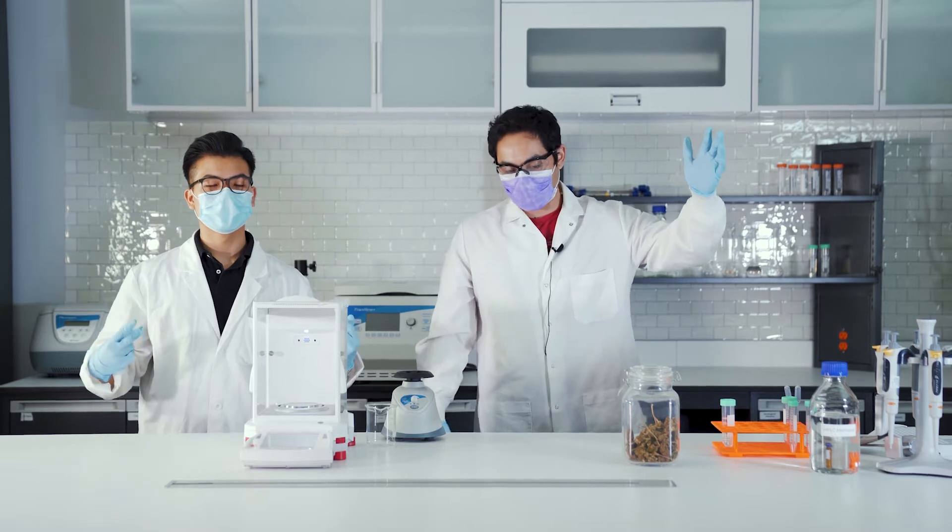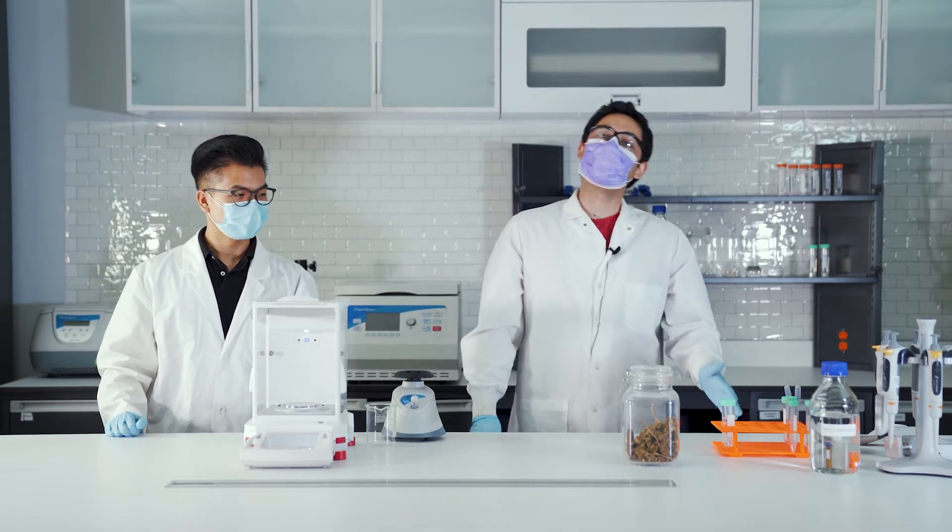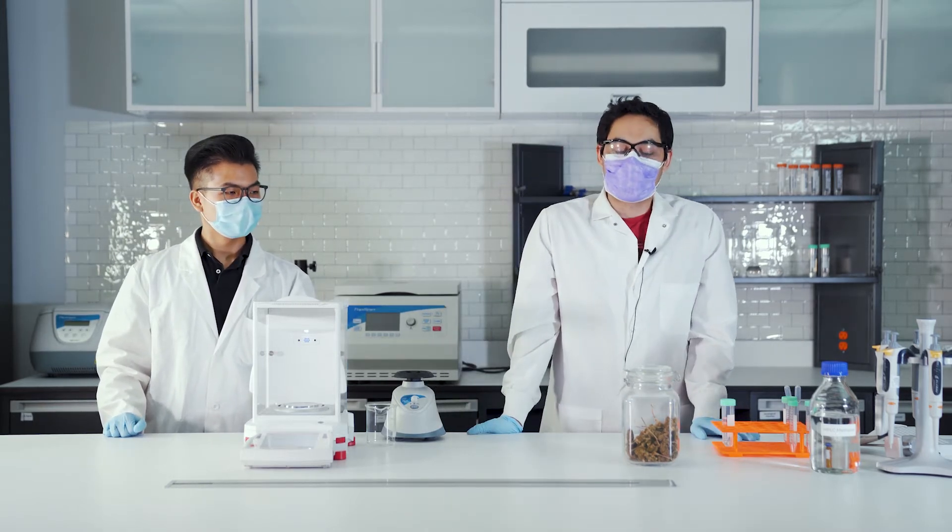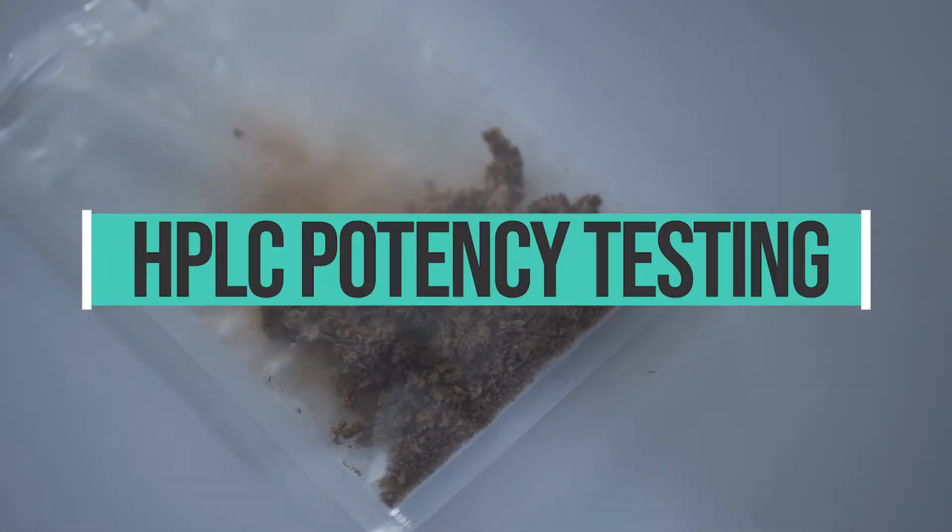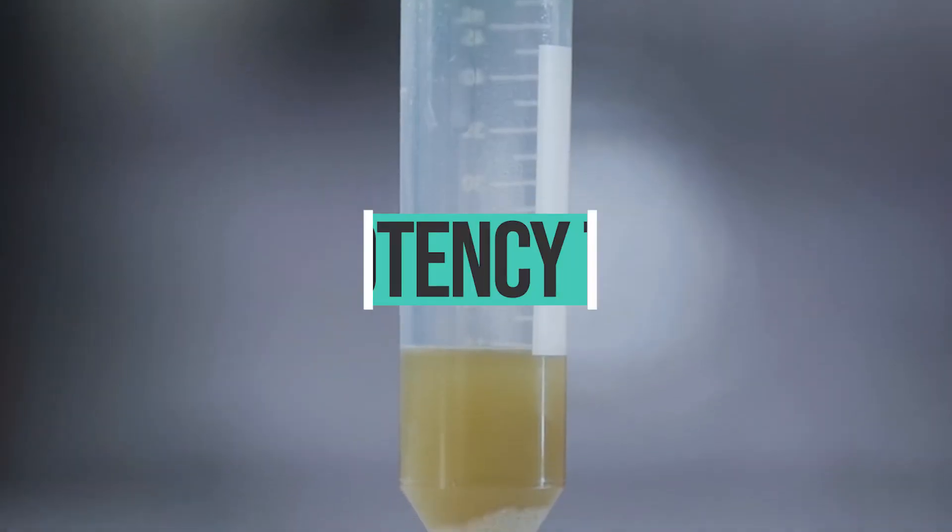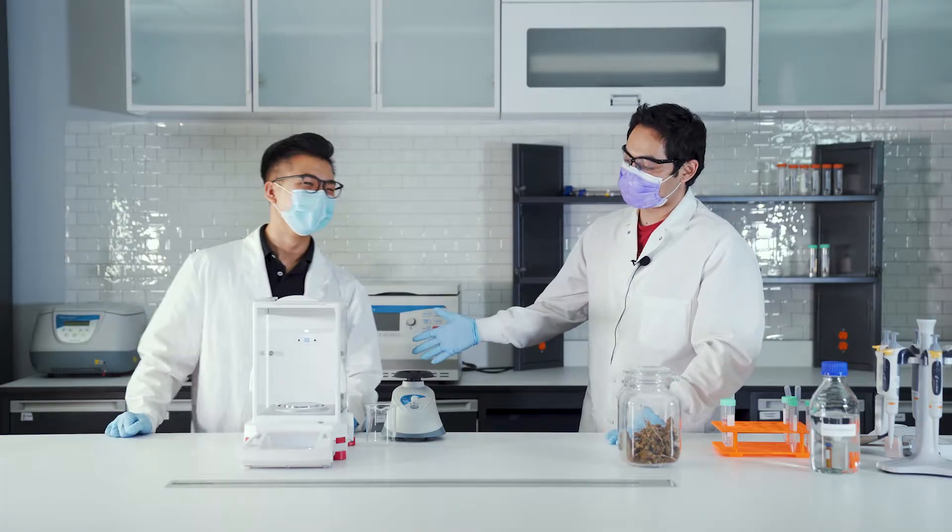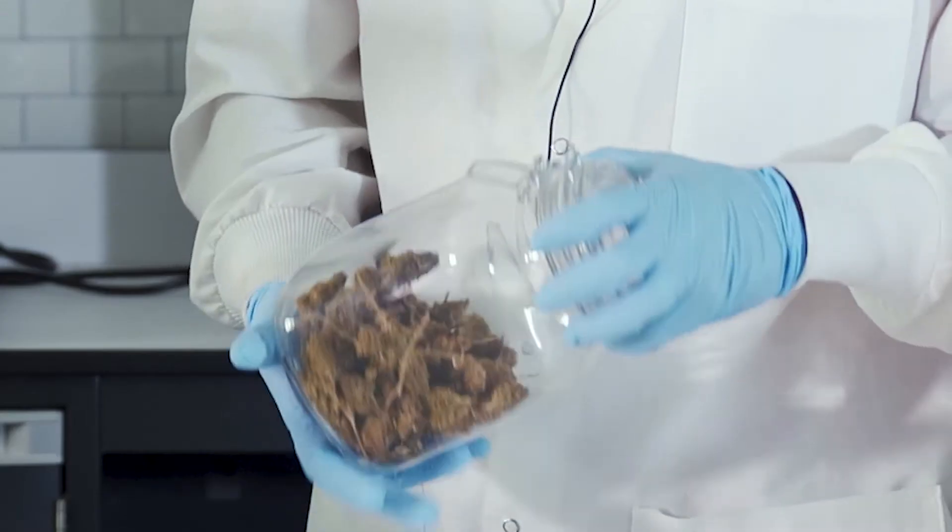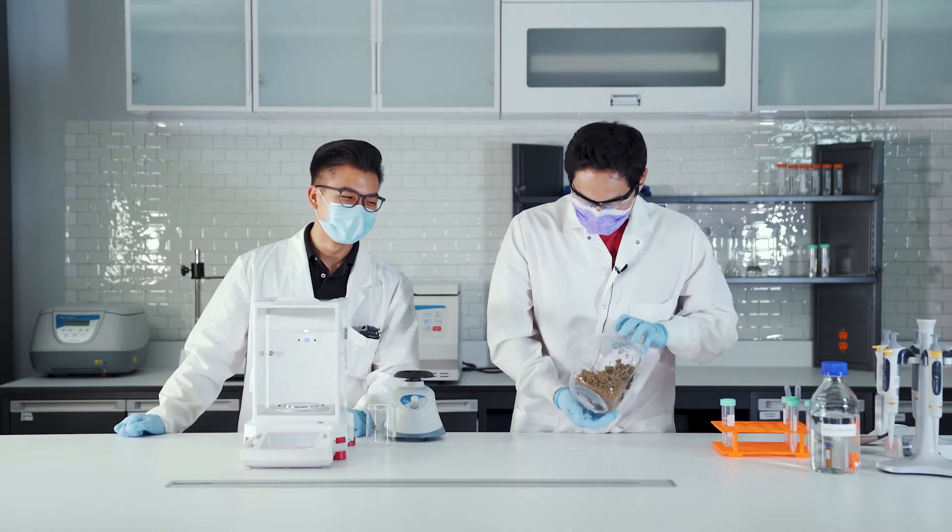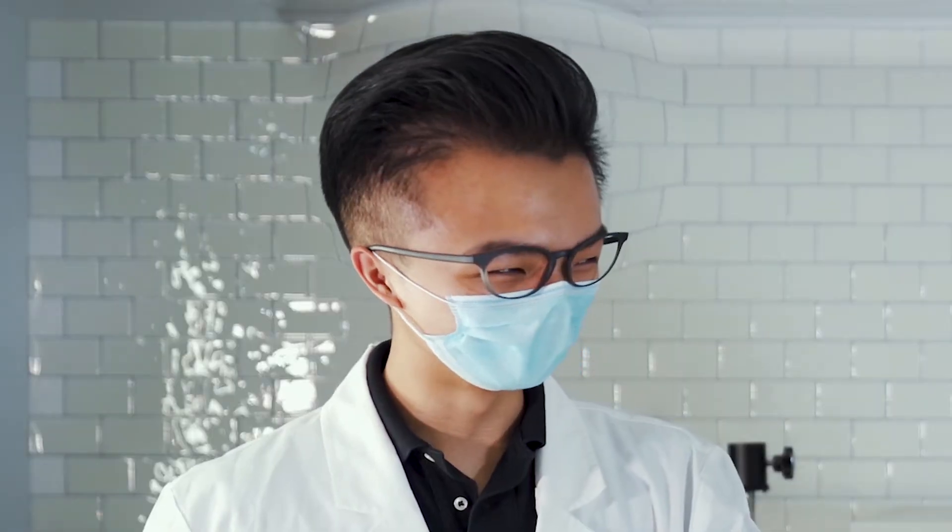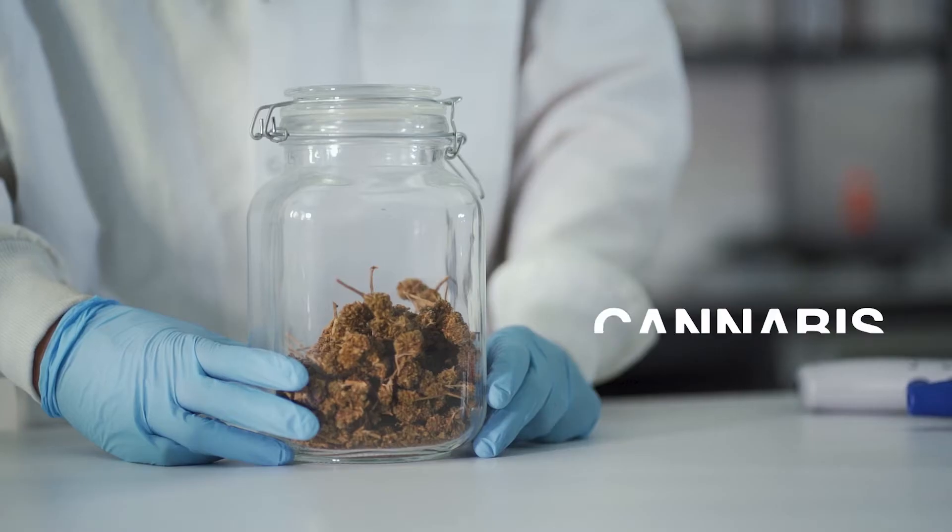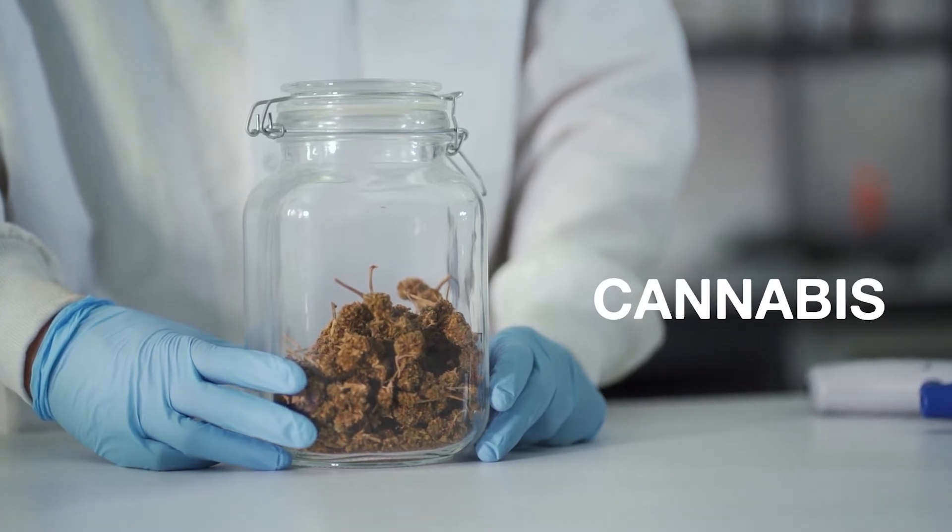All right, what's going on everybody. Today we have an excellent video for you. We're gonna be doing potency testing by HPLC in cannabis flower. Here today with Scott. What did you bring in? This is some of the worst cannabis I've ever seen. It's rare, because people don't normally put this in their bodies, but for demonstration purposes it's fine.